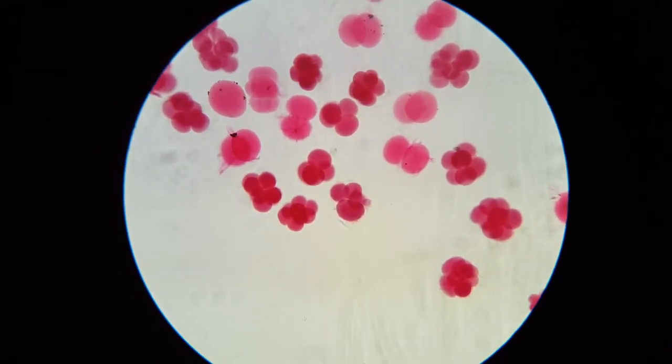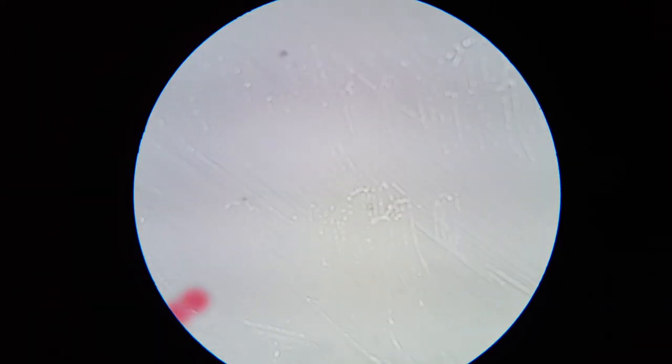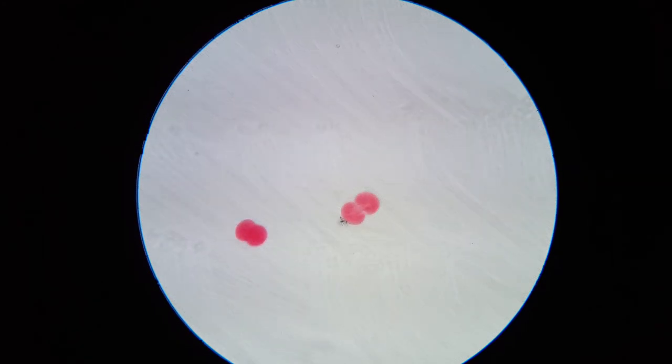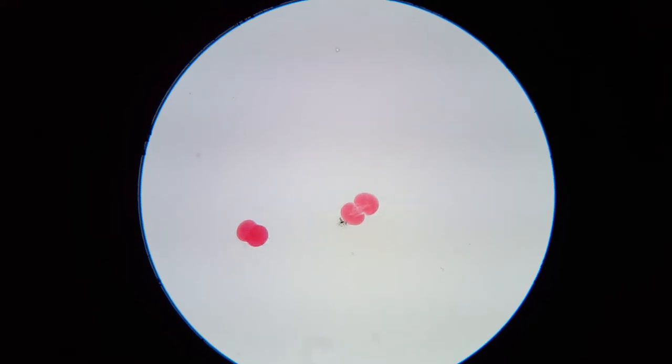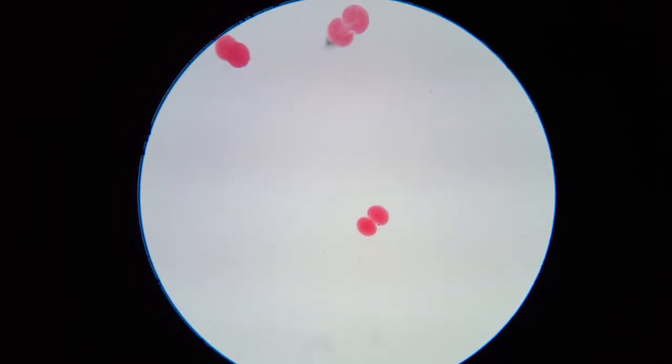We're not going to emphasize this slide too much because there's so much on there. We're now switching into place the two-cell stage. You can see the specimens are in different locations, still under the 10x objective, more or less still in focus. There are little streaks of oil on the slide — nothing like cleaning the slide. So the two-cell stage is simply the post-mitotic division of the zygote.